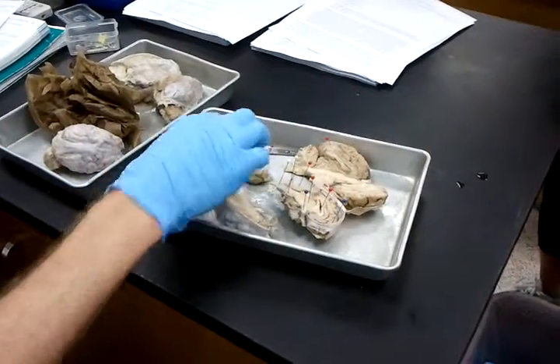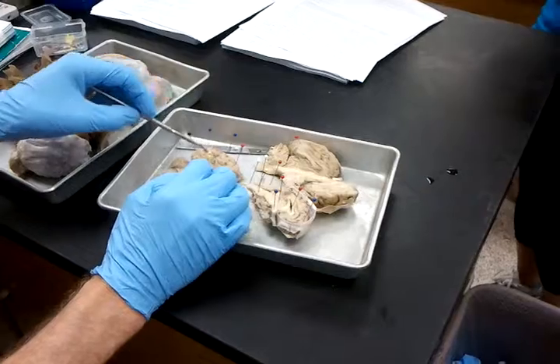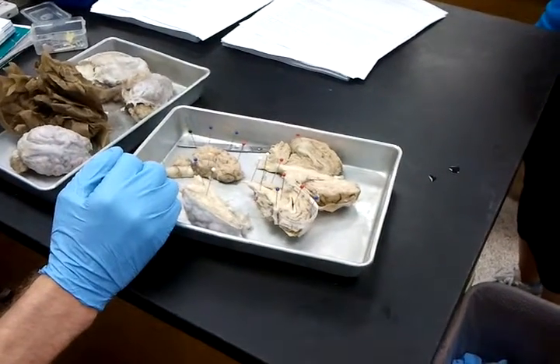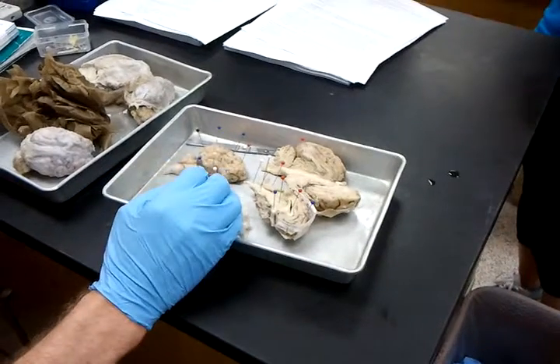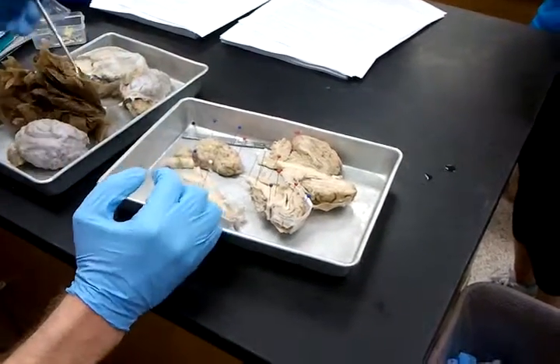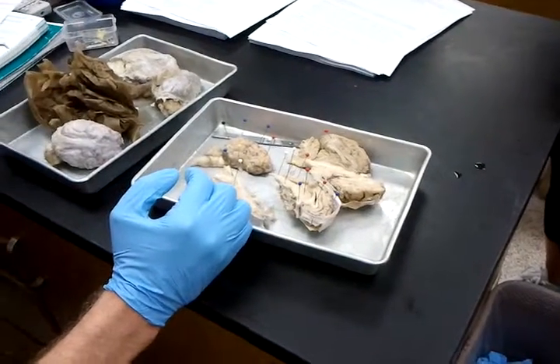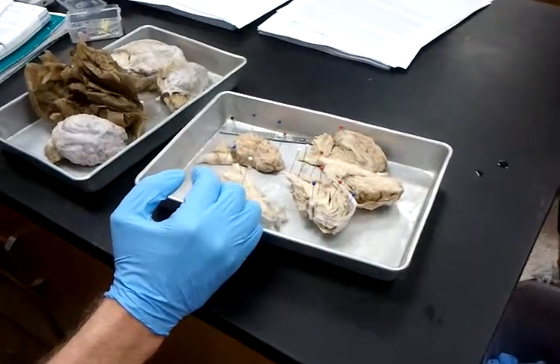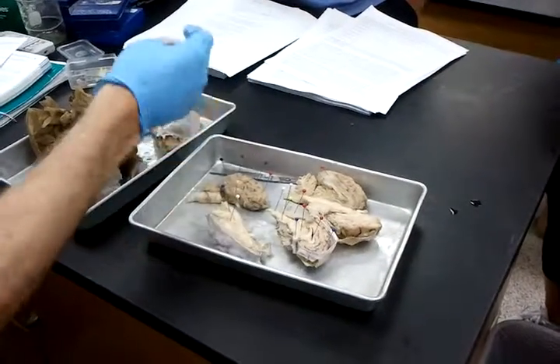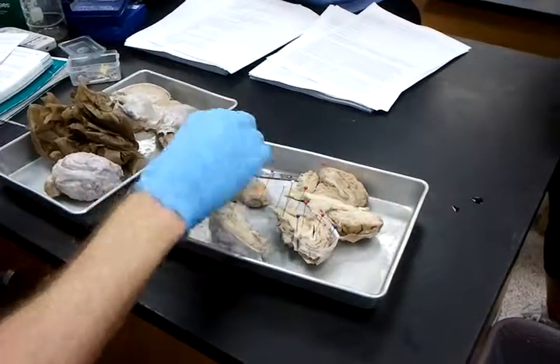Pia mater you kind of have to use your imagination for, because it's basically covering the folds of the brain here. It's like a real thin layer. So if I'm asking for the mater, I'll have a little question out below it asking which mater is this, which mater is that. I'll be sure to make it a clear question. So I may actually have this out. It might not be a bad idea. So dura mater, pia mater covering the folds.